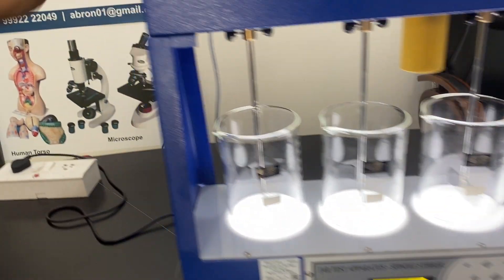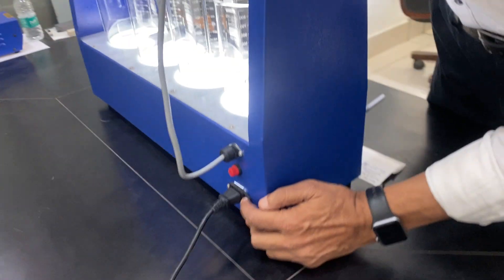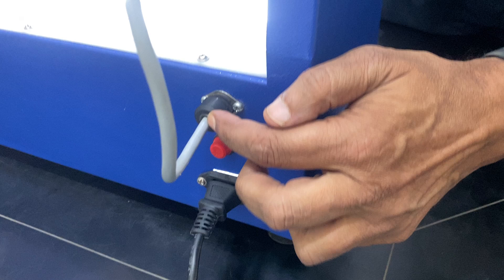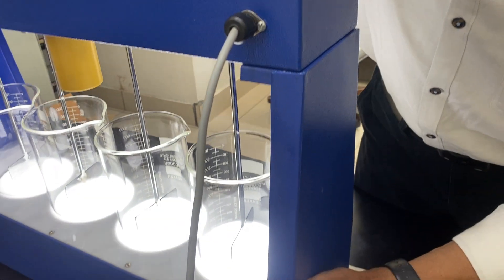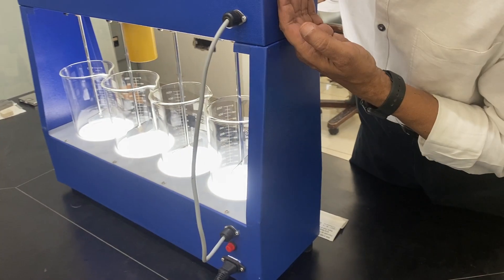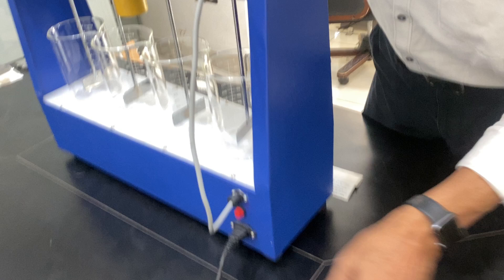On the back side there is a power adapter. When it comes to you, you have to attach this wire so that the top of the motor will be connected.